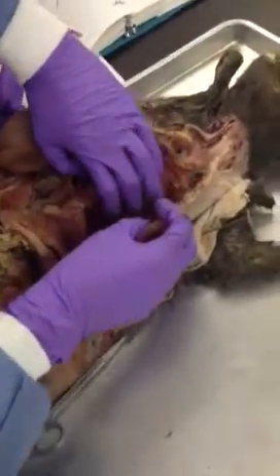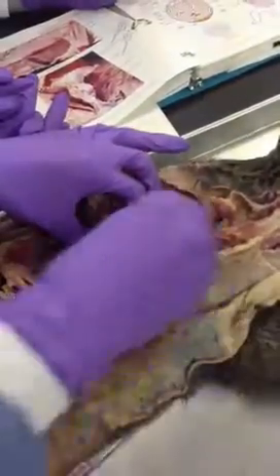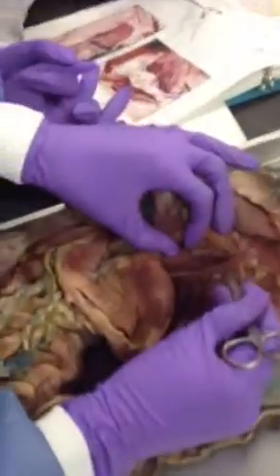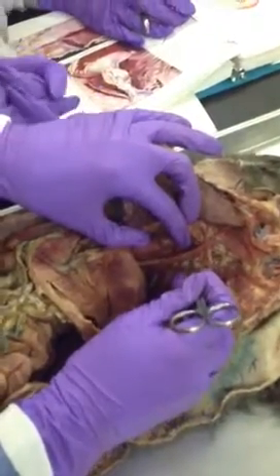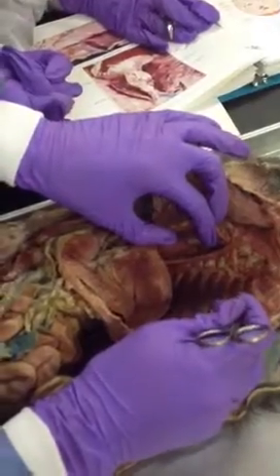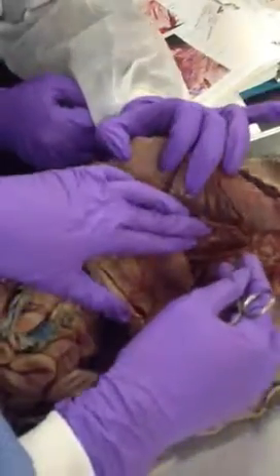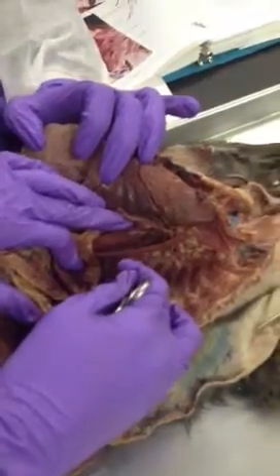To this side of it, that right there. Be very specific though. Yes, so this is the dorsal aorta. The other way I can tell is you see these little blood vessels coming off of it to feed into the anterior thoracic wall. I know it's a blood vessel then. So this is dorsal aorta. And you see these little blood vessels coming off to go into the anterior thoracic wall.